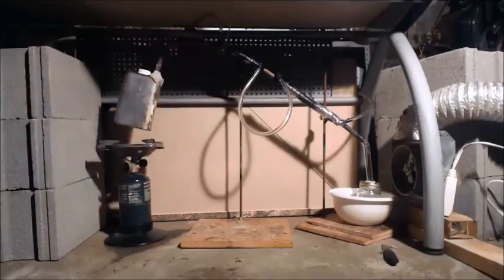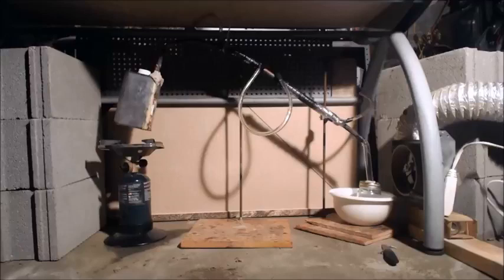I got my water cool condenser. Oh man, I'm going to put bags of ice over top of that too. This should only take like 5, 10 minutes. It should be quick, I hope, because I want to get it over with. It's scaring the heck out of me.